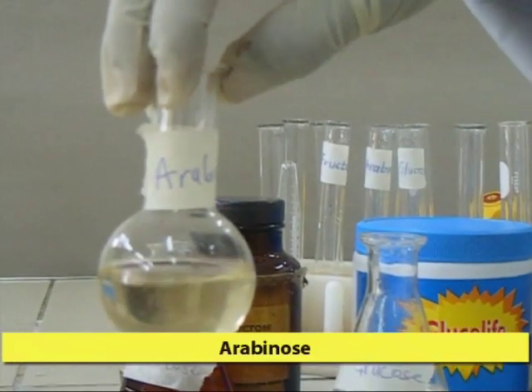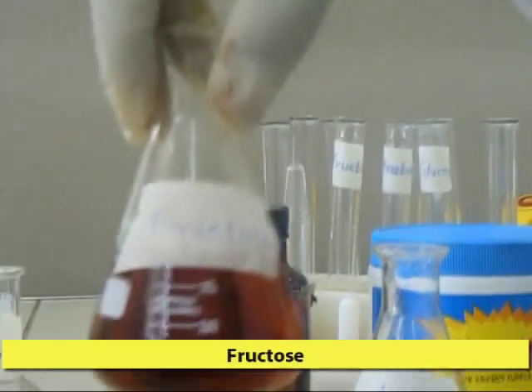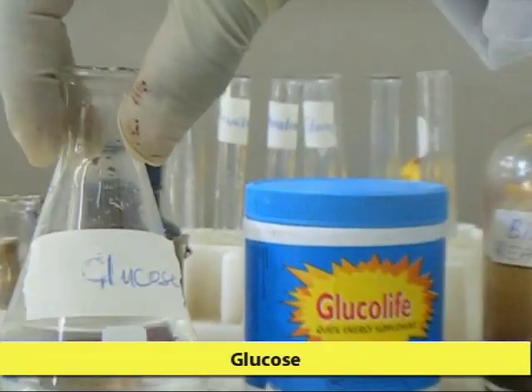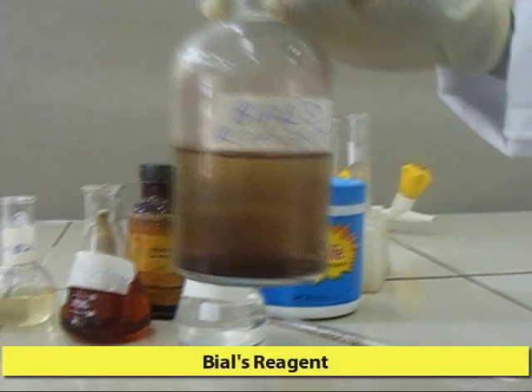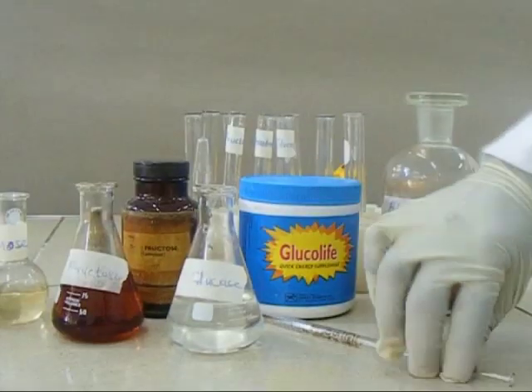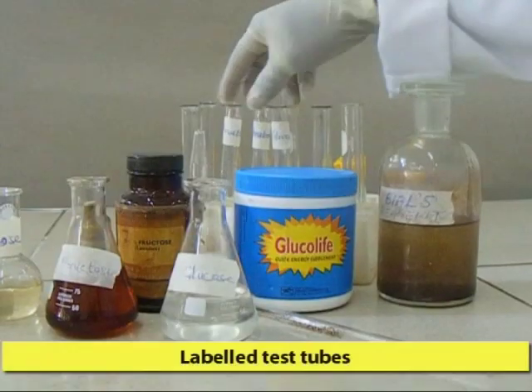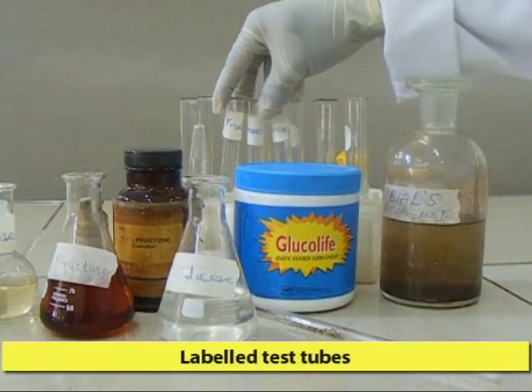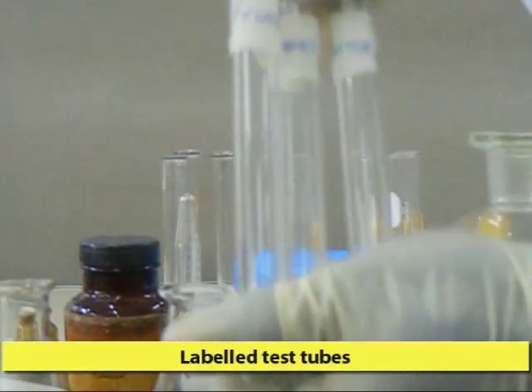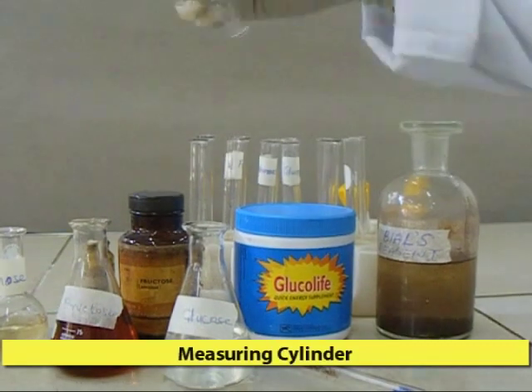The test solutions used are Arabinose, Fructose, and Glucose. Materials required include Bial's Reagent, a pipette, labeled test tubes, and a measuring cylinder.